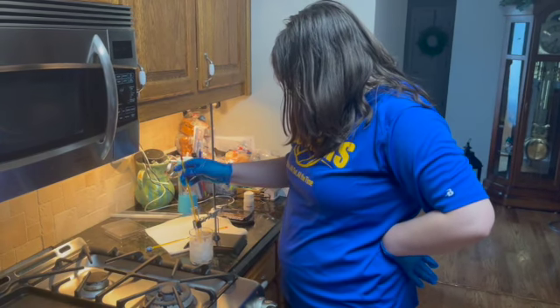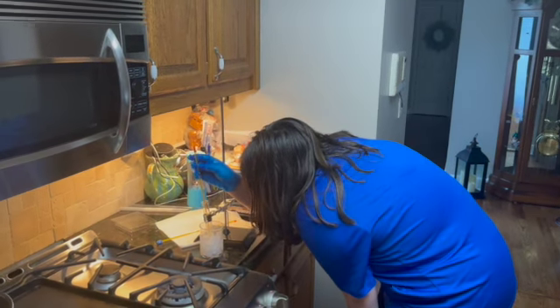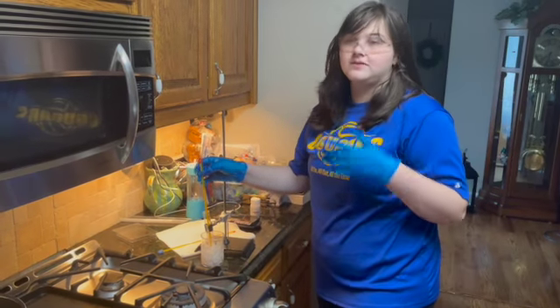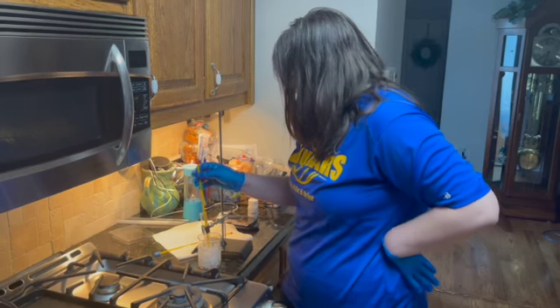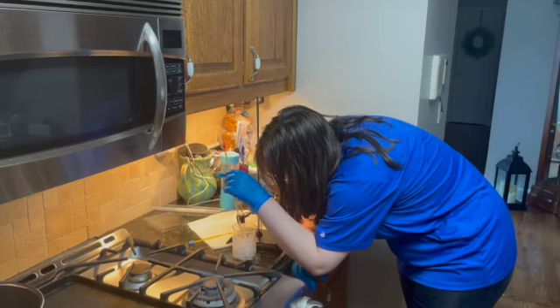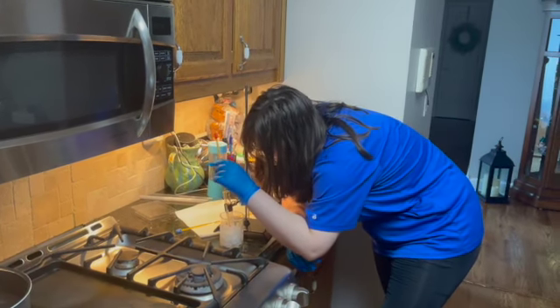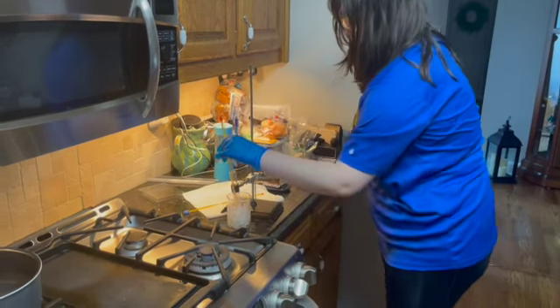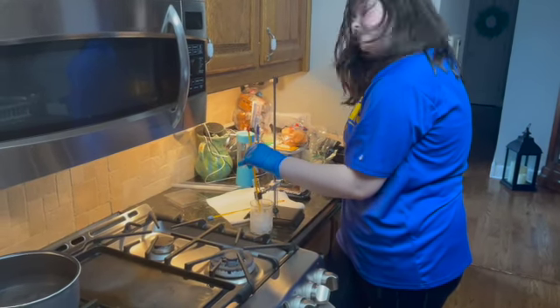So we have reached the 4-minute mark, and the temperature is at 32 to 33, so maybe like 32.5 degrees Celsius. And looking at it, it seems like there's still liquid in there. You can clearly tell, but around the edges has fully frozen over. So now we're just waiting for the middle to freeze.